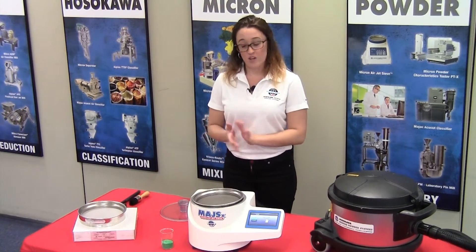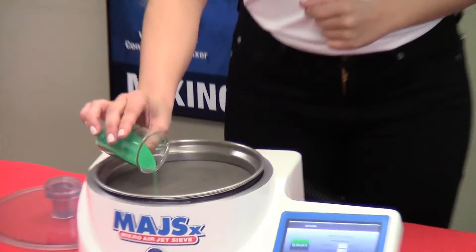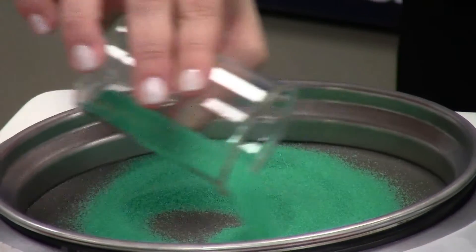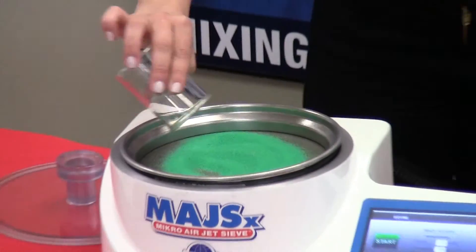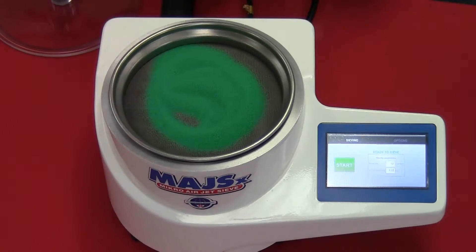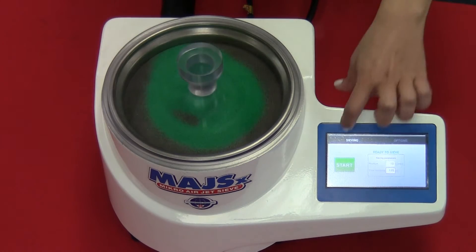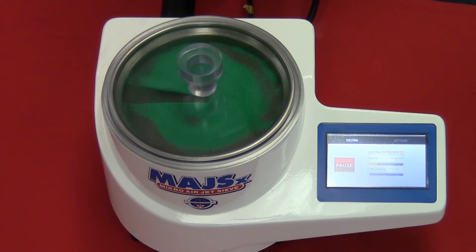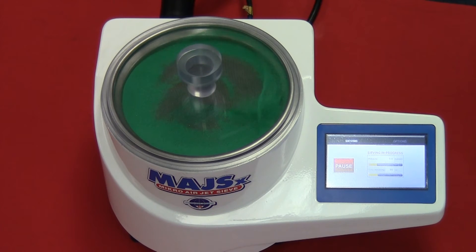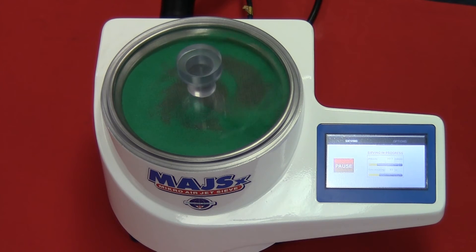Once we confirm all that, we're going to introduce our sample to the sieve screen. You want to distribute your sample around the sieve screen evenly, so that all of the particles in the material have a chance to be introduced to the sieve screen. Once your sample has been introduced, we're going to place the lid on top and press start. As the air wand rotates, you can see that the particles are coming in contact and distributing evenly throughout the sieve screen.